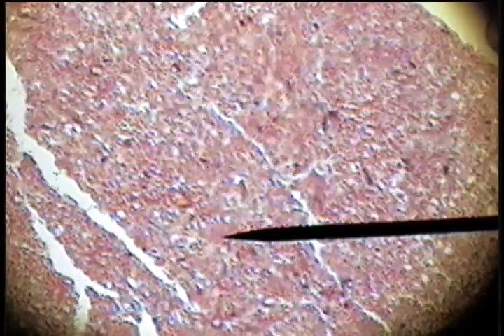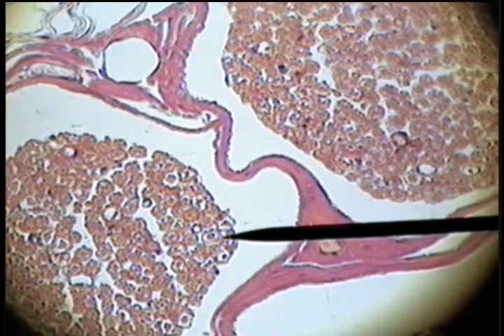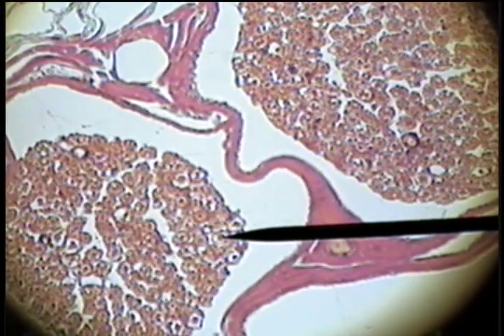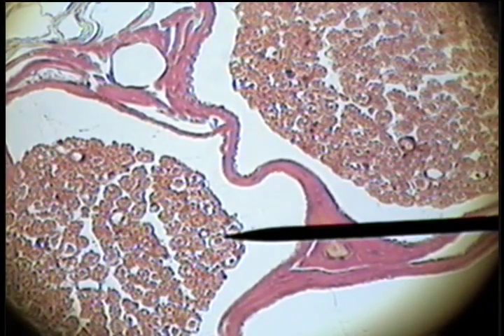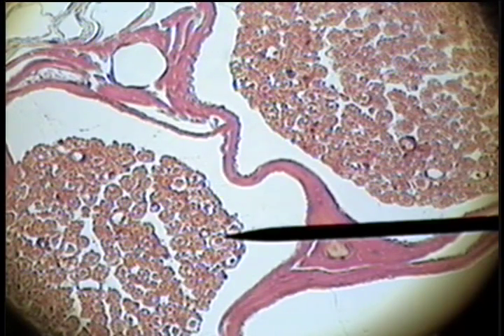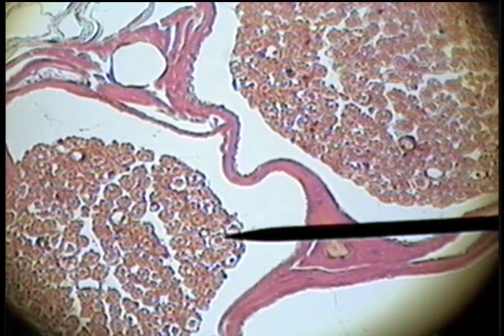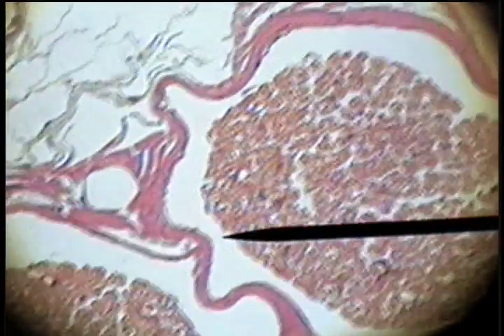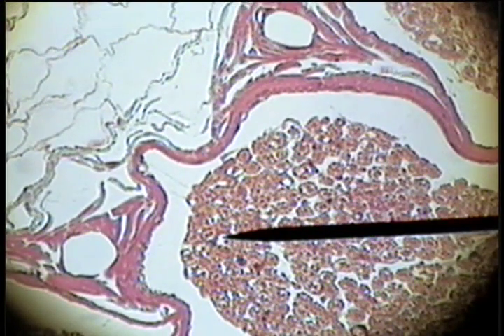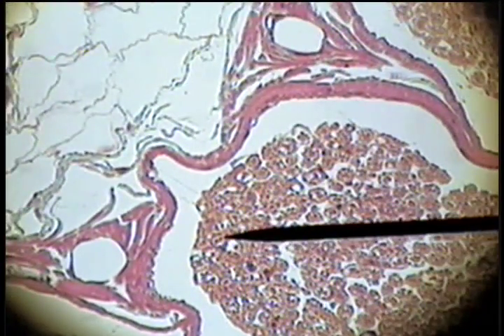When we look at higher power in this cross section, we can see the dark central dot, which is the axon fiber — the nerve conducting element — the light space, which is the myelin sheath, and then the endoneurium on the exterior. Here's another axon, the white is the myelin sheath, and then the outer endoneurial covering.